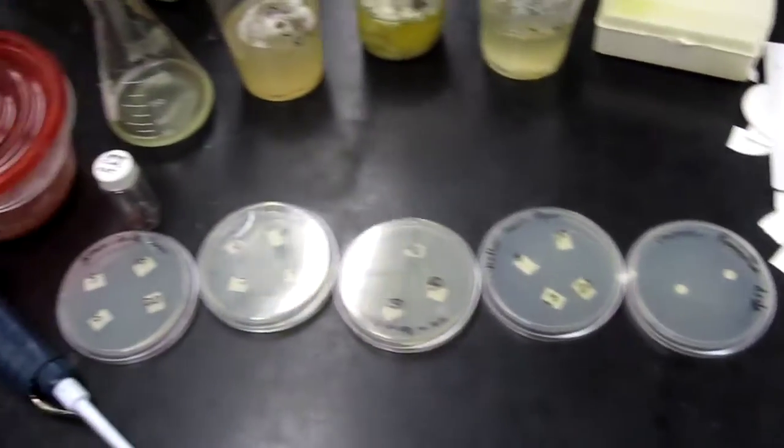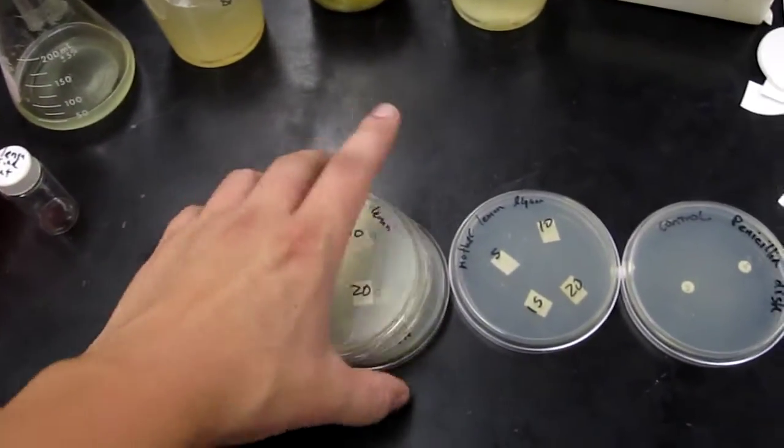We'll put these in the incubator, let them grow for a day or two, and check for rings of inhibition.